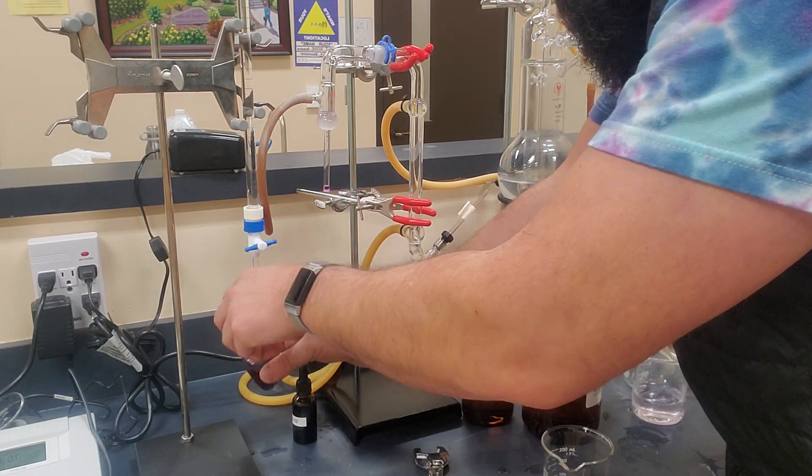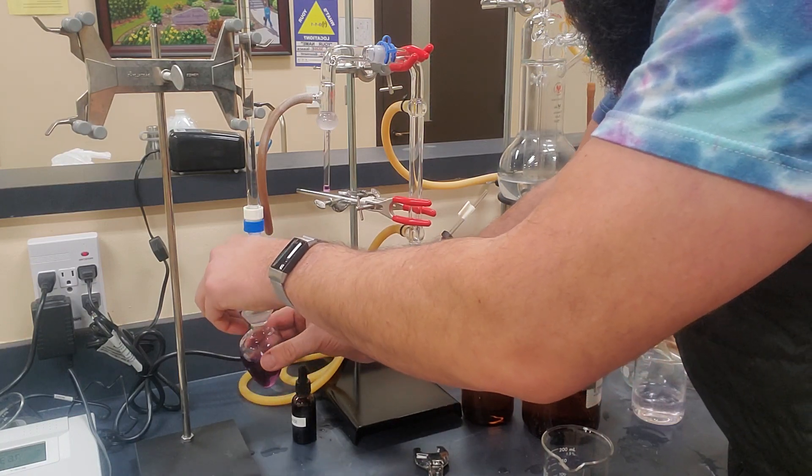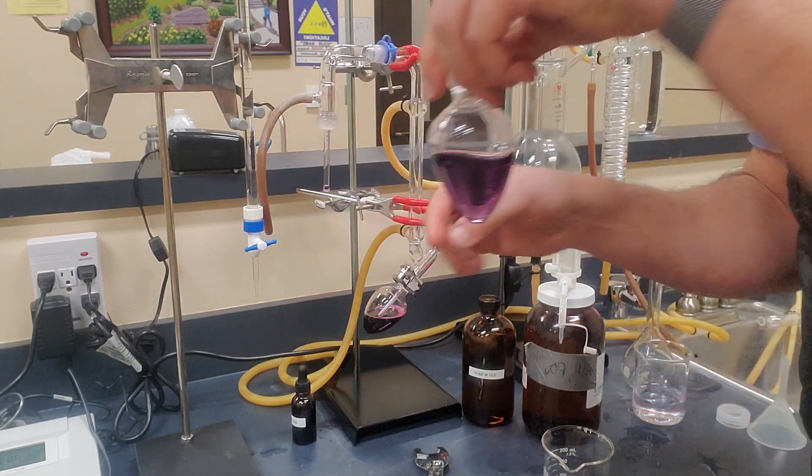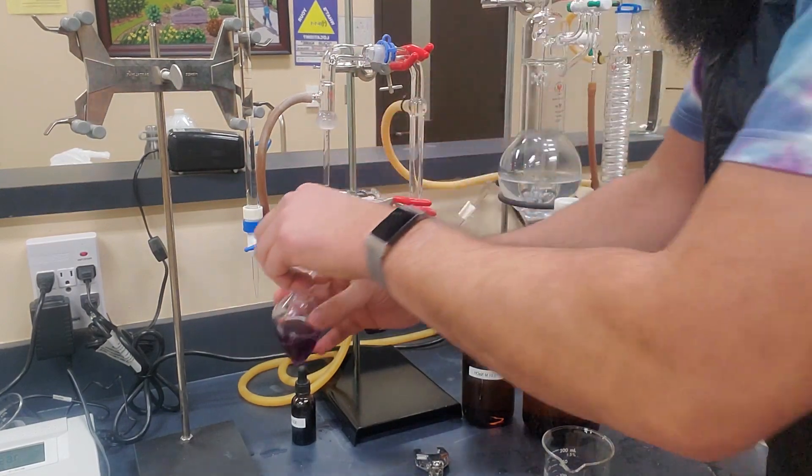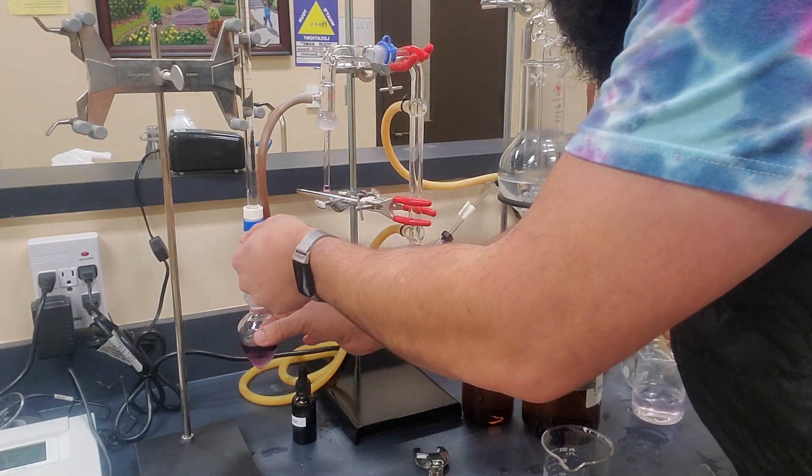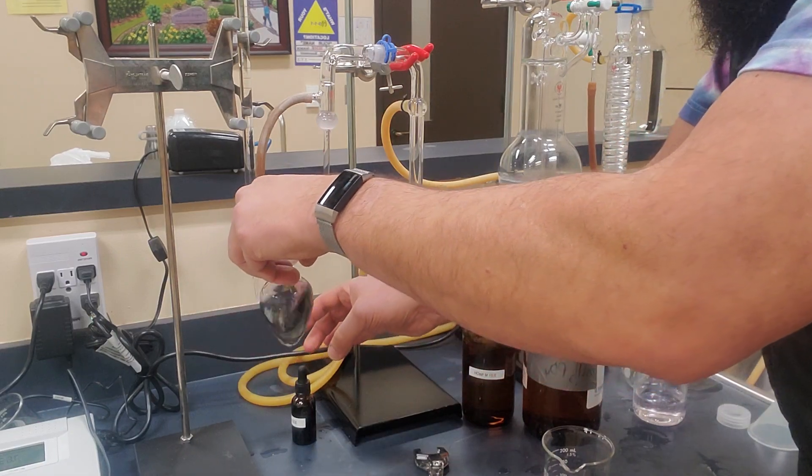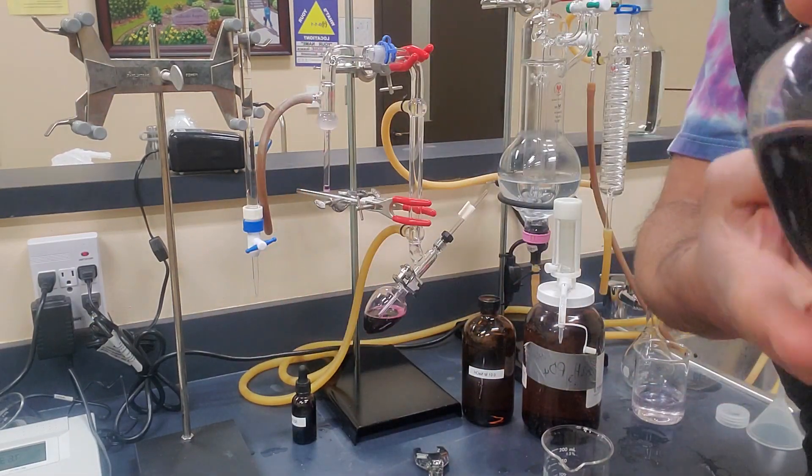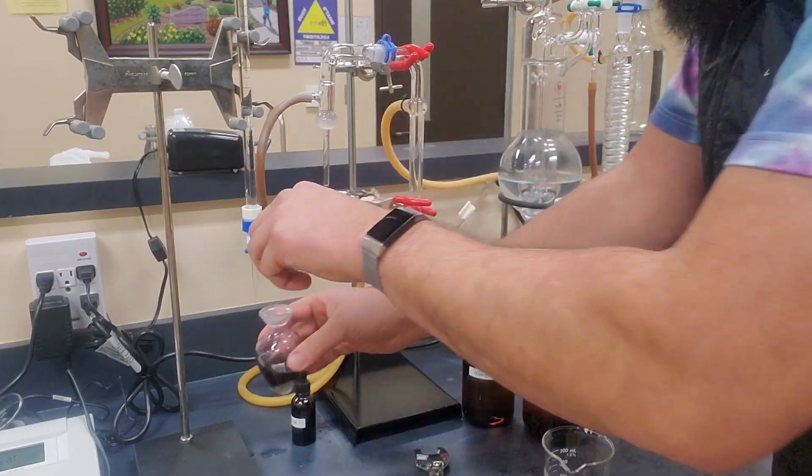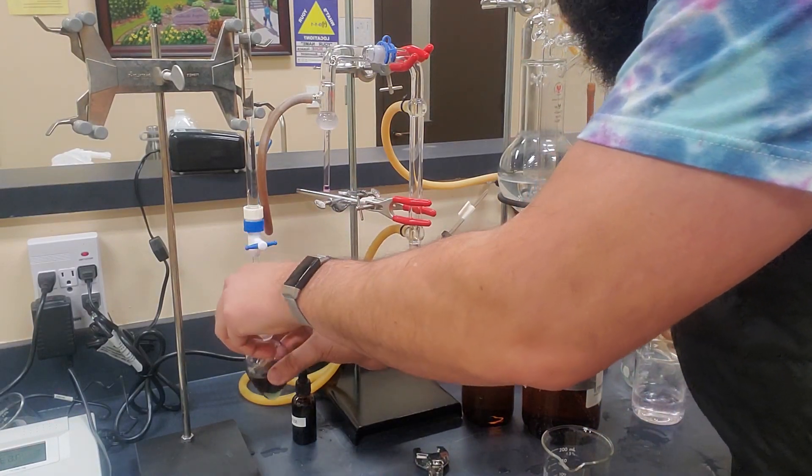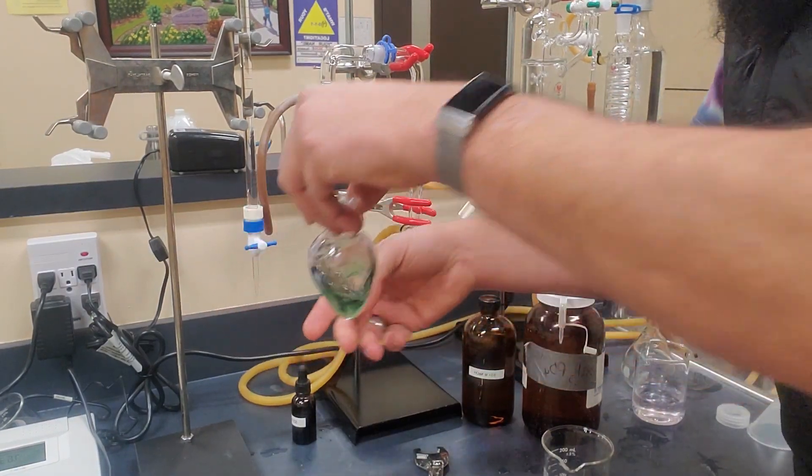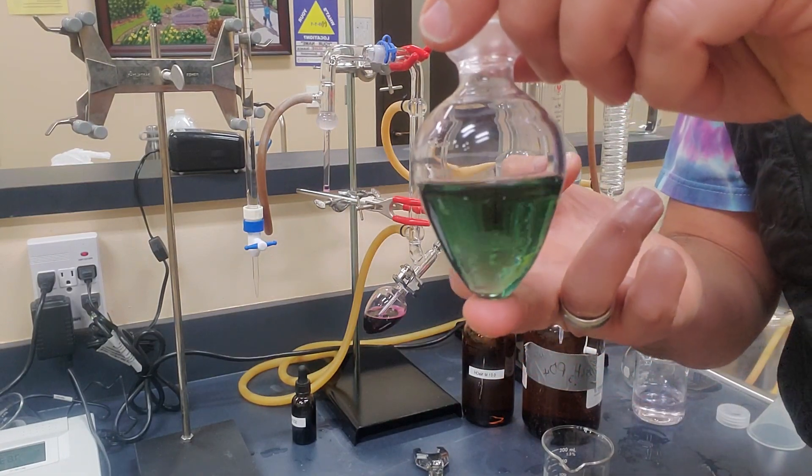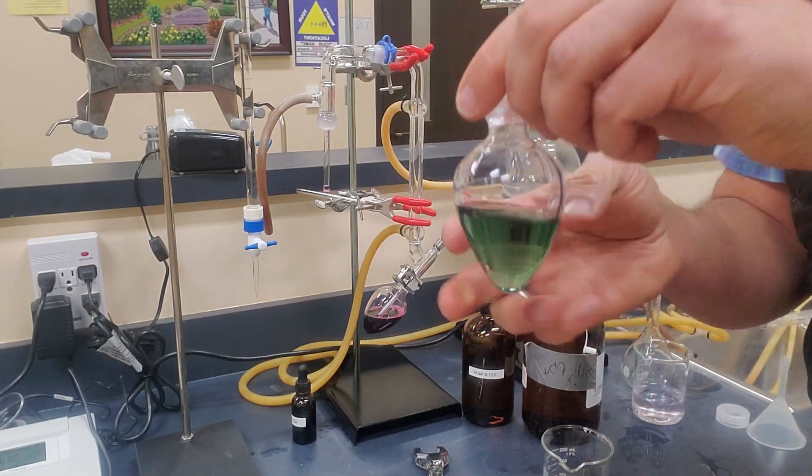You can see that the color purple is already a little bit darker. So this isn't going to take much more. One more quick little turn, and we're not quite to the olive green that we started at yet. Do one more quick turn. And now we're nice back to that perfect olive green. Not flashy green, just nice and olive green.